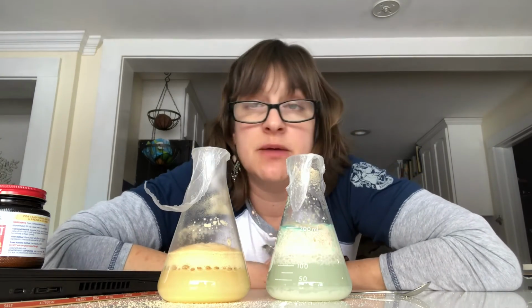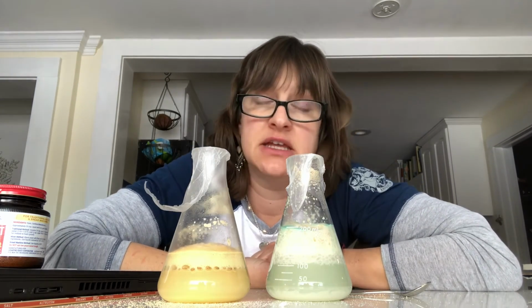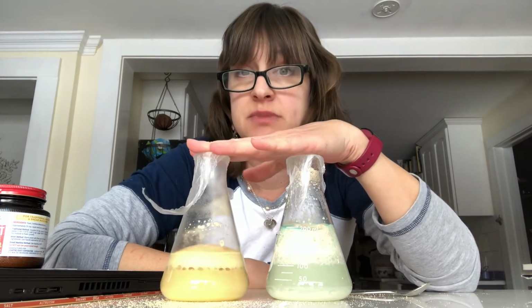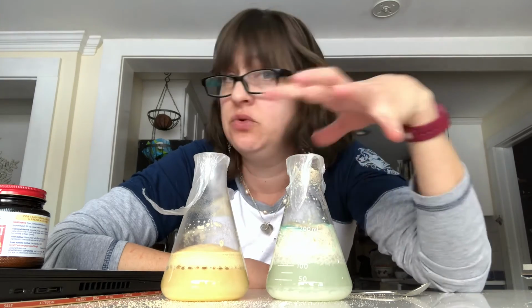Again, check the top of that lab, or go back to the beginning of this video where I told you what the color changes would mean. And why were they blue and why are they not blue now?